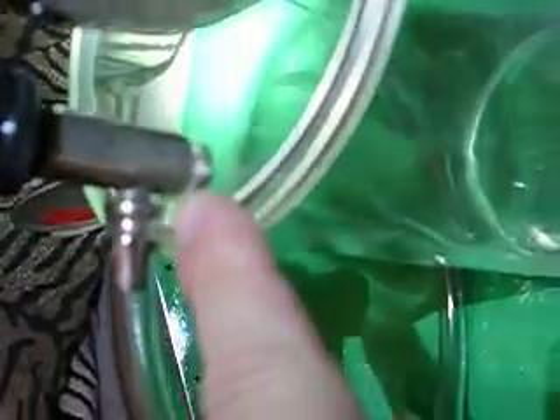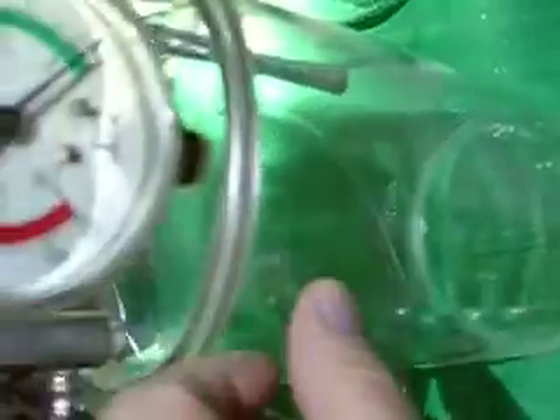This is what goes to the equipment that wants to take the suction — notice it's all the way at the top. Actually, I said that wrong — you want to put the suction here. Yeah, I said that backwards. Your device connects here so that any water that falls in or comes in won't get sucked back up. Whatever.